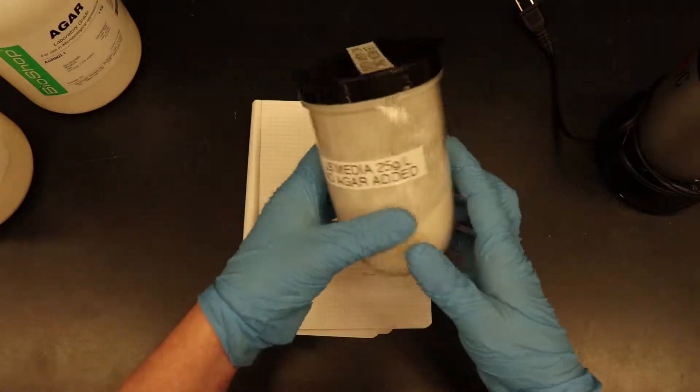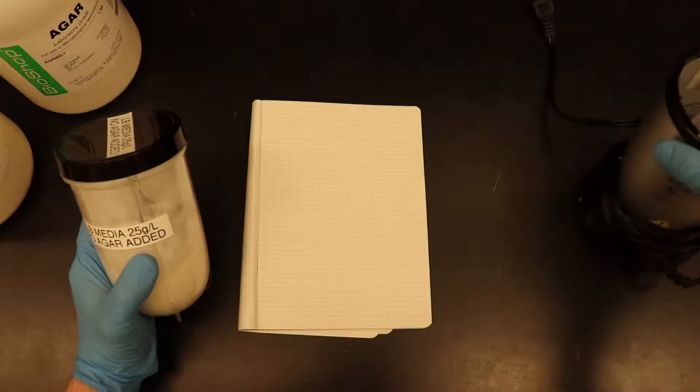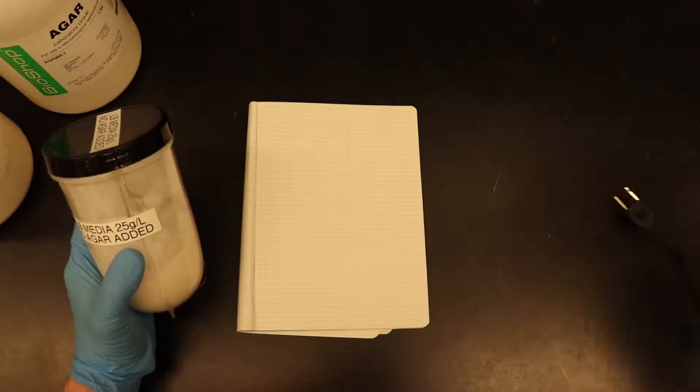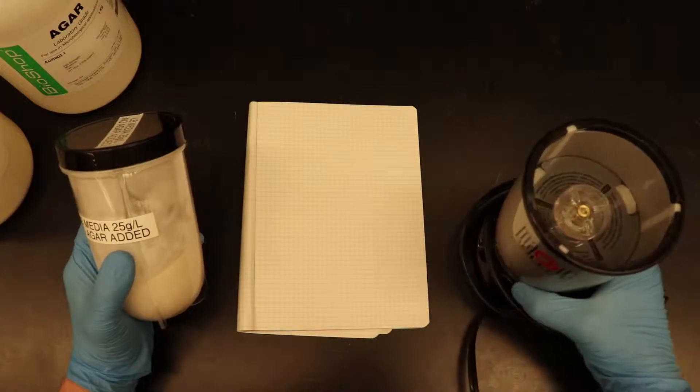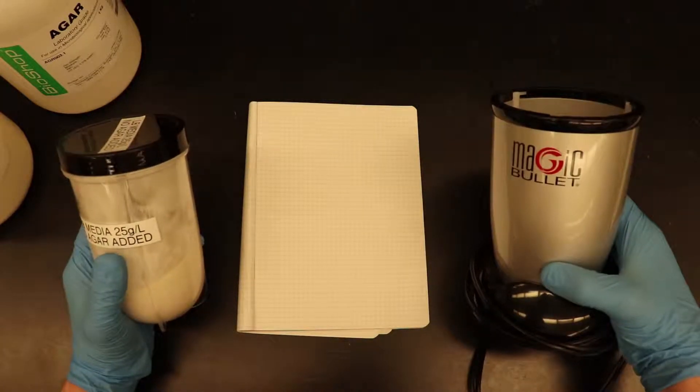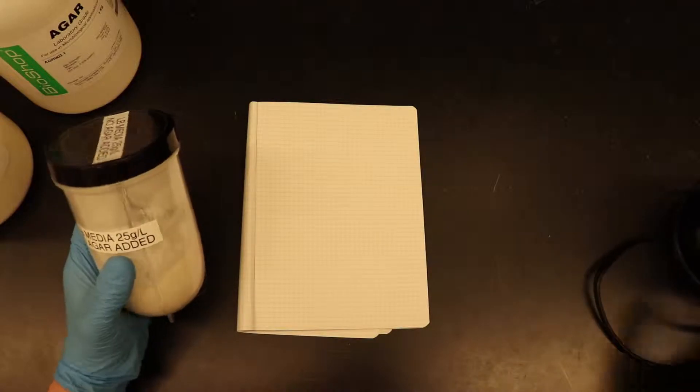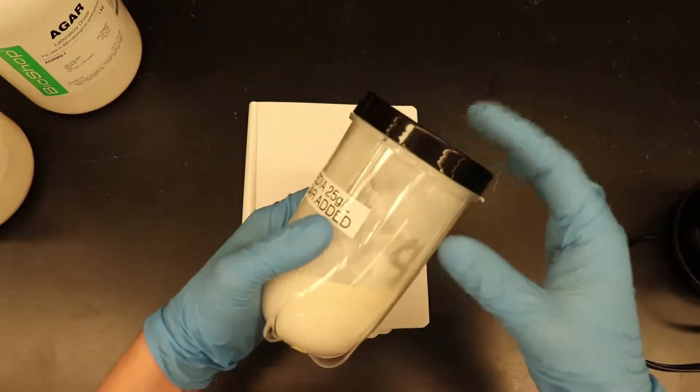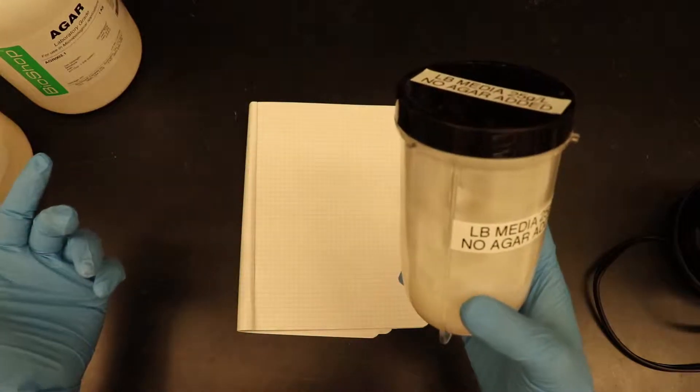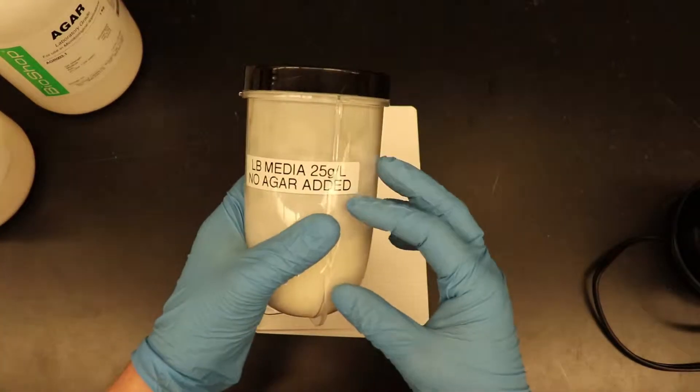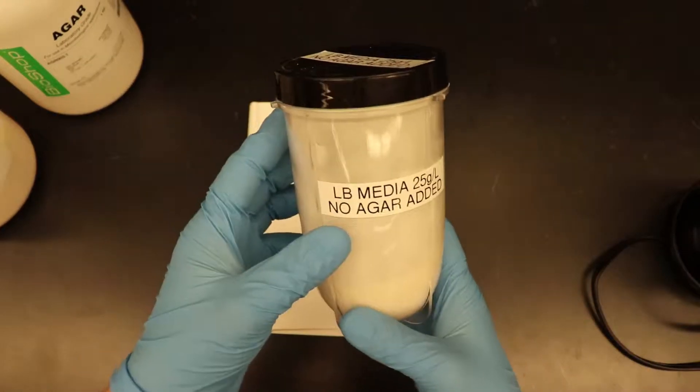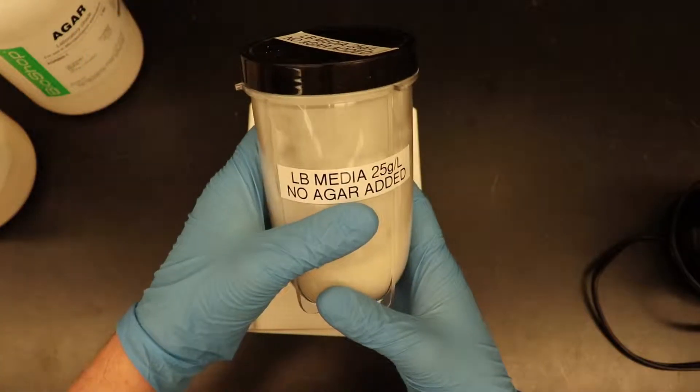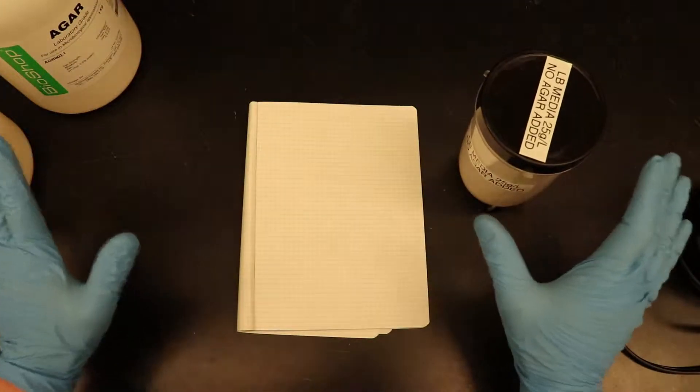So really it's pretty simple. First of all you need to go to Amazon, I'll provide links, or you can go to Walmart, wherever you get your cheap crap basically. Get yourself a magic bullet, a blender, it comes as a set, and get yourself a couple of extra of these pods and a couple of extra lids because what that allows you to do is it allows you to make media inside these pods. You grind them in the pod, you mix them in the pod, and you put a lid on, slap a label on it, and then you just keep it right there.